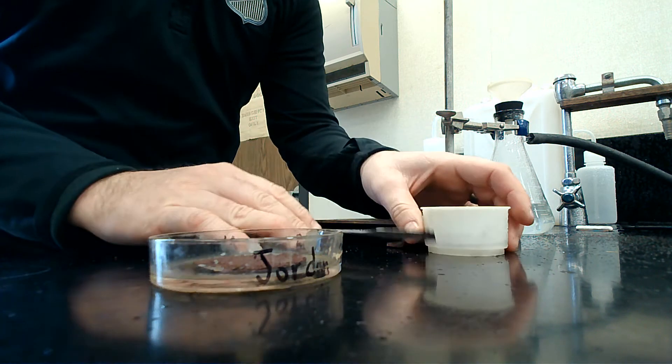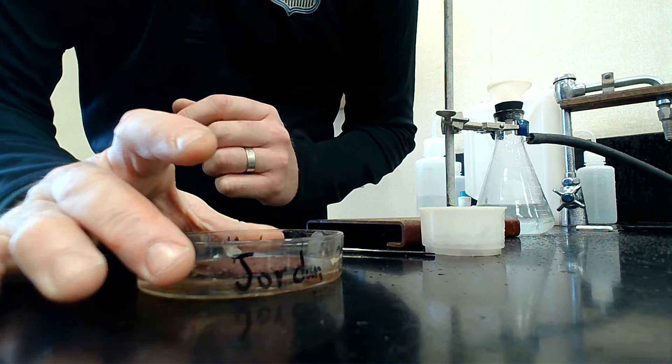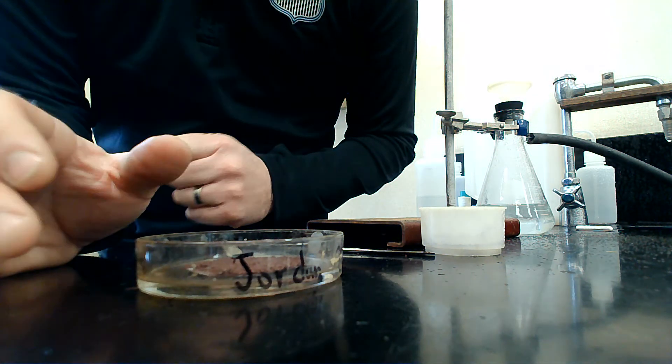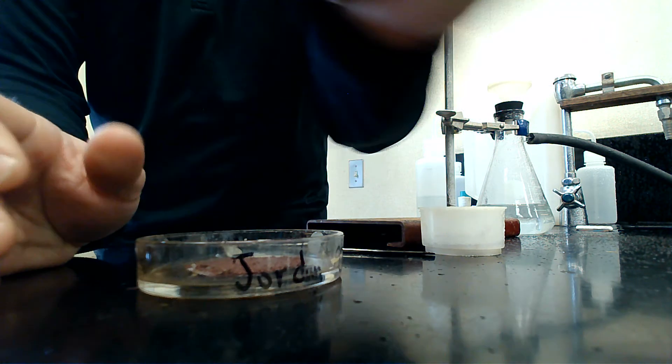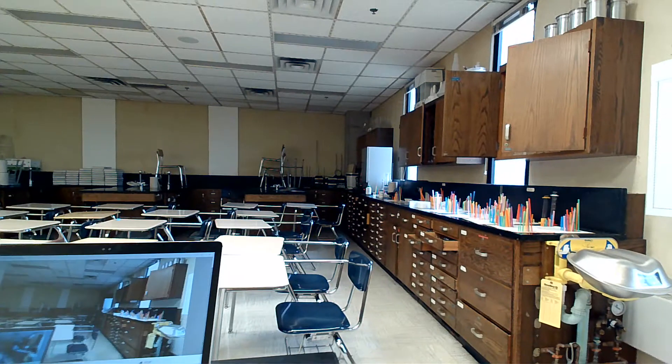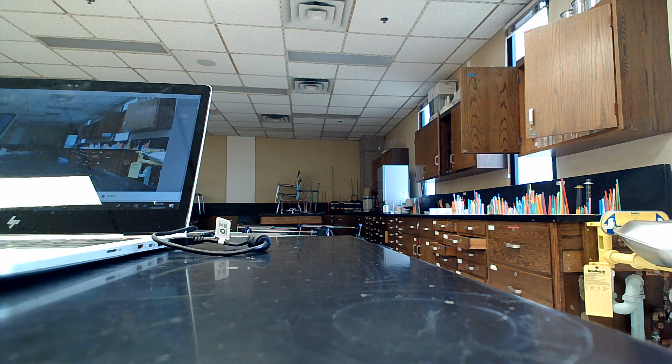I'm going to put it in the oven, which is right there—the big gray thing—and be back.